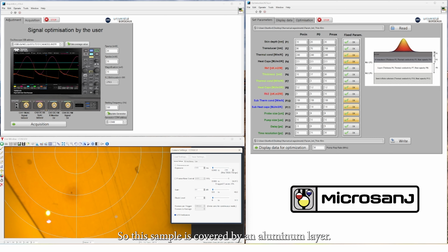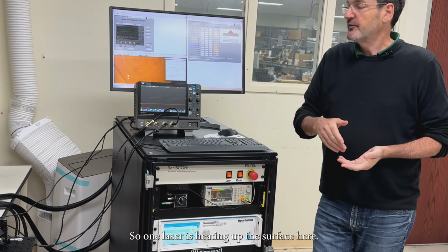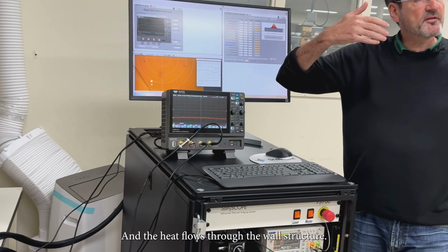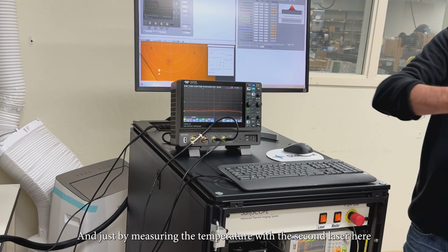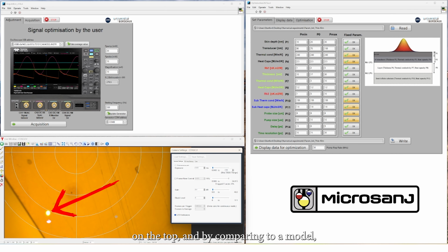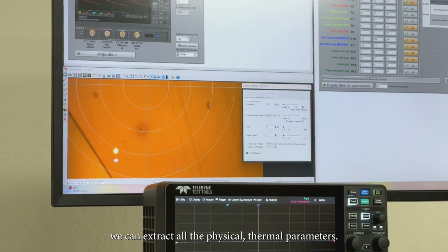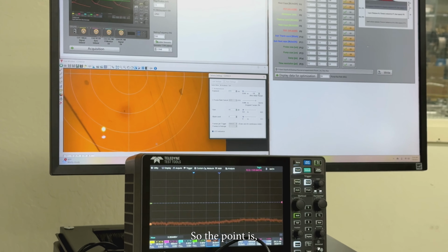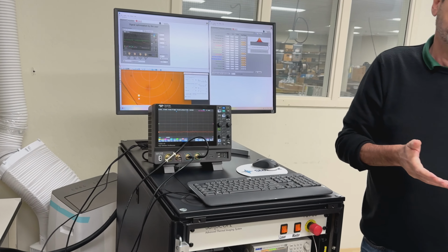So this sample is covered by an aluminum layer, and under this aluminum layer there is a stack of different materials. So one laser is heating up the surface here, and the heat flows through the whole structure, and just by measuring the temperature with a second laser here on top, and by comparing to a model, we can extract all the physical thermal parameters. So the point here is how to get this signal quite easily for the customer.